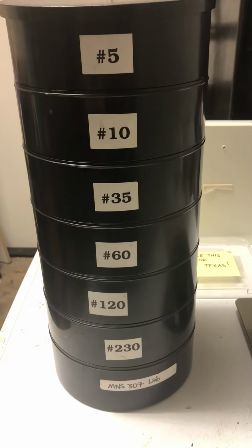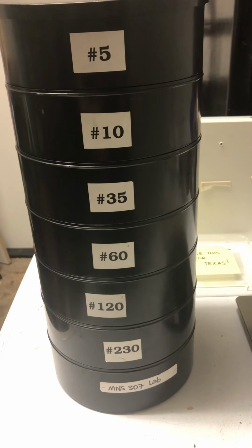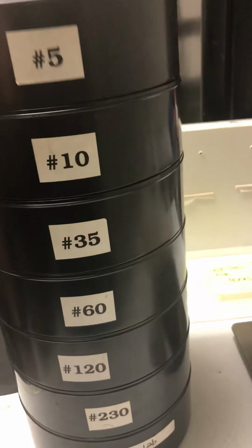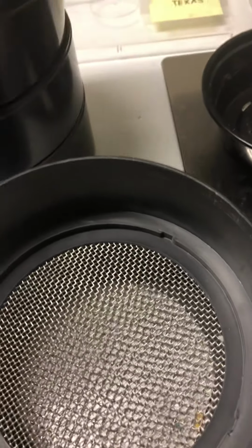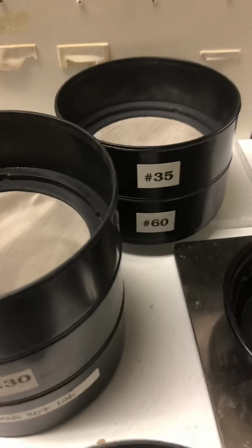Exercise 9.1. First, let's take a look at the sieve we'll use to separate the fractions of the Texas sand. This sieve has 6 different screens. As you can see, this topmost screen has very large holes and will only trap the very largest of particles. The next screen has holes that are slightly smaller, but still will only trap fairly large particles. And so on, down to our smaller screens that will trap much tinier particles. Now let's make sure that our sieve is in the proper order.